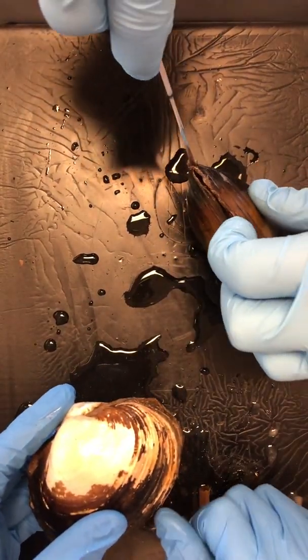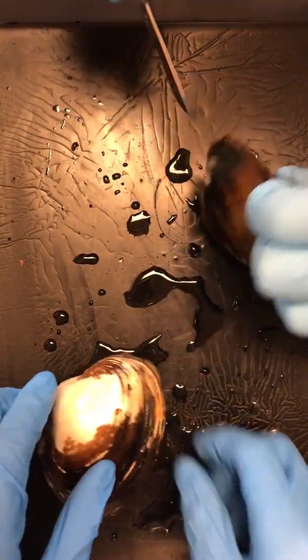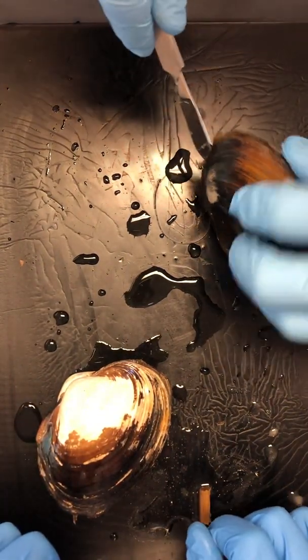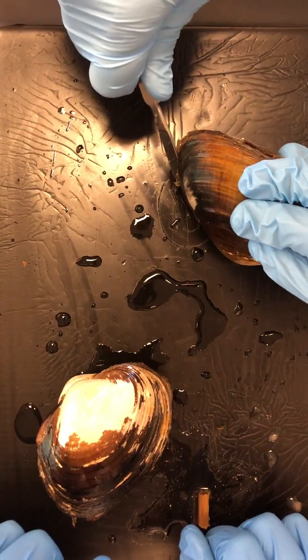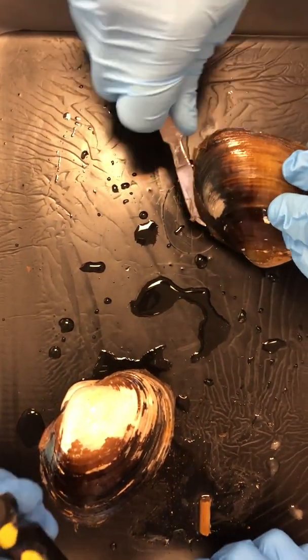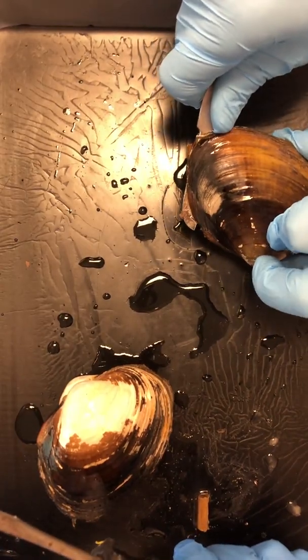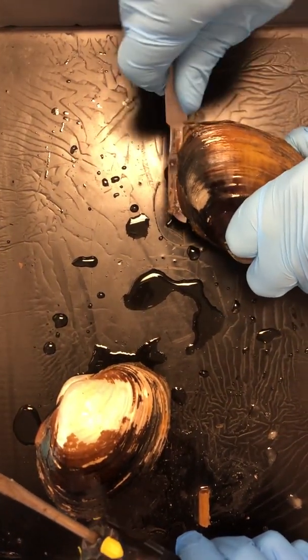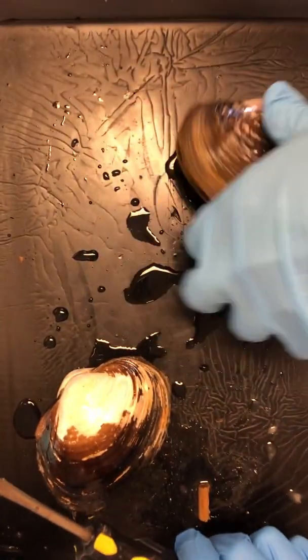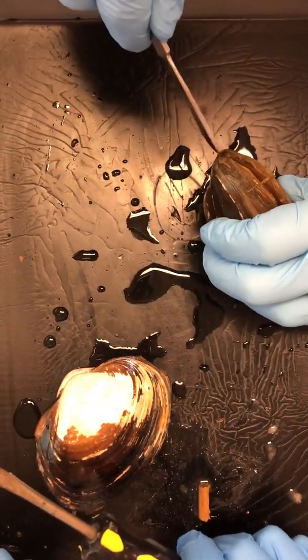It's going to take a little bit of brute forcing. I don't want to break it. You can't. It's impossible to break this guy. Excellent. And then if we need to, we've got our cool screwdriver to pop him open. Excellent. Good form. You need muscles to play with mussels. I'm going to use that joke probably 6 times because I think it's hilarious.